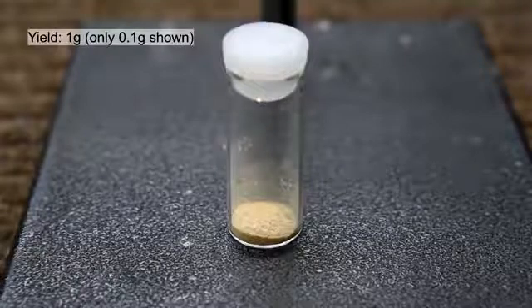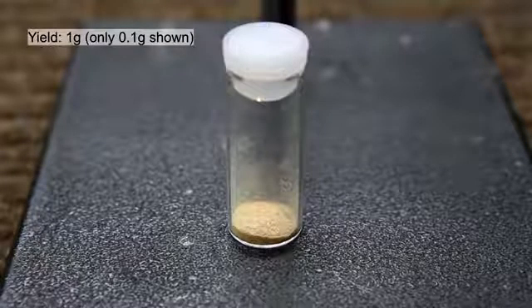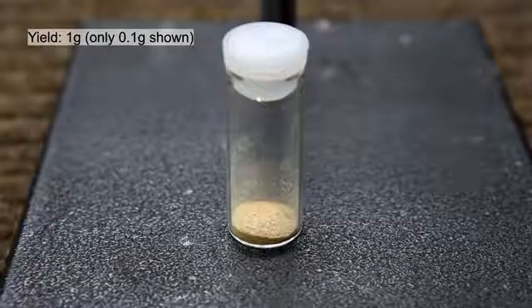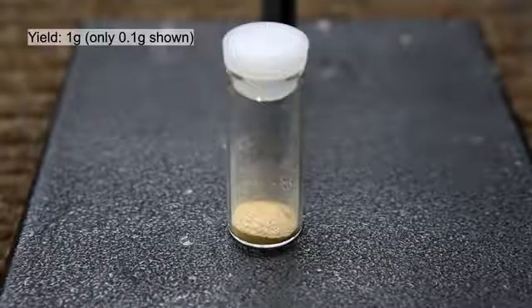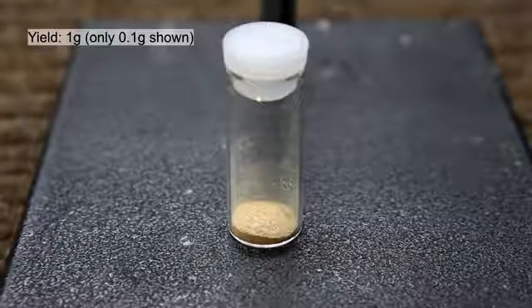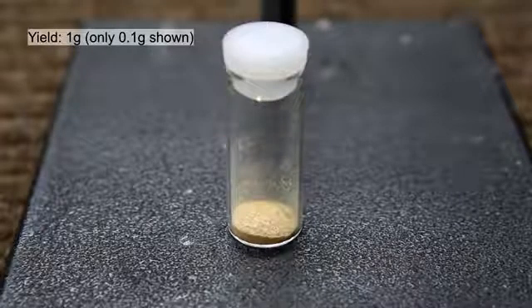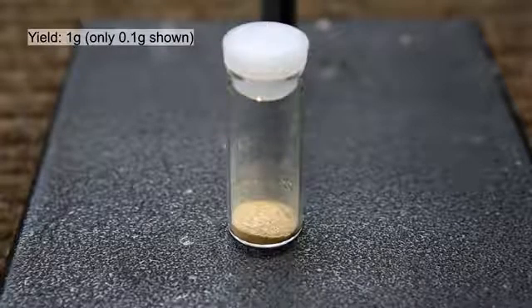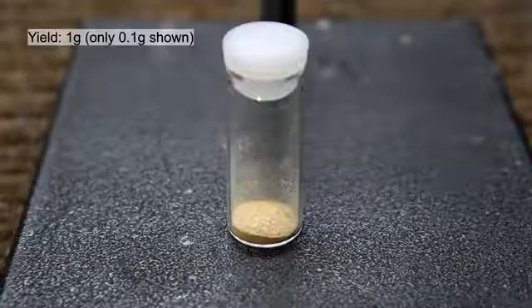After letting it dry overnight, I'm not sure why, but the phenolphthalein turned brown. Shown in this video is only about 0.1 grams, but the final yield was actually around 1 gram. So, in theory, you could expect about 10 times the amount that you see here.